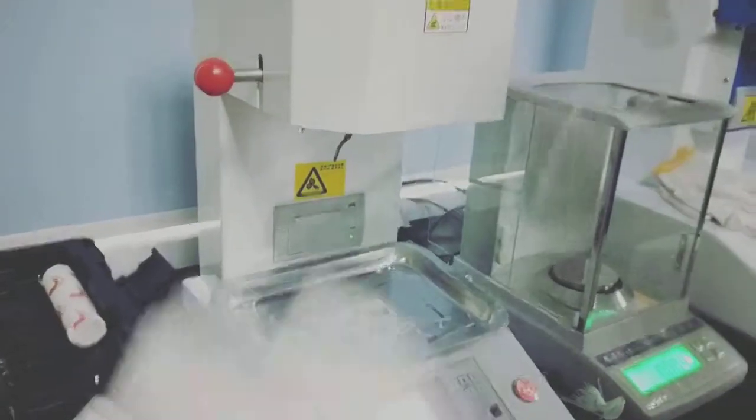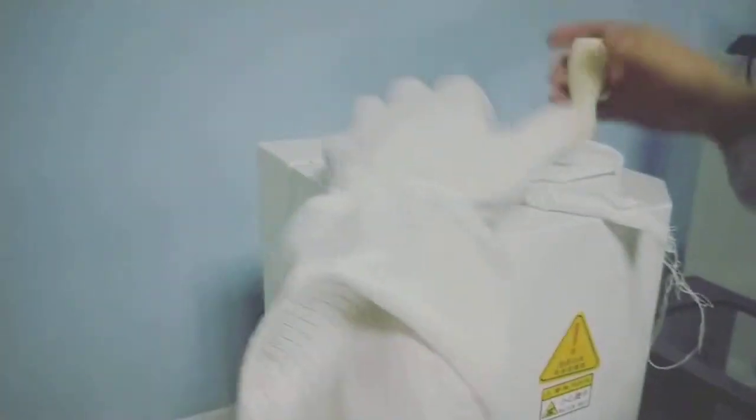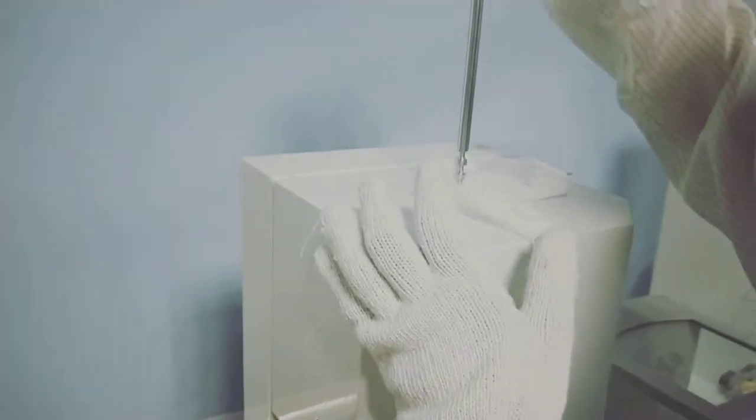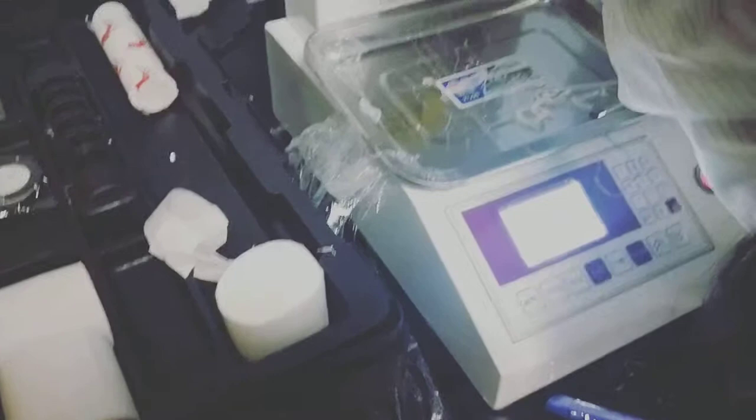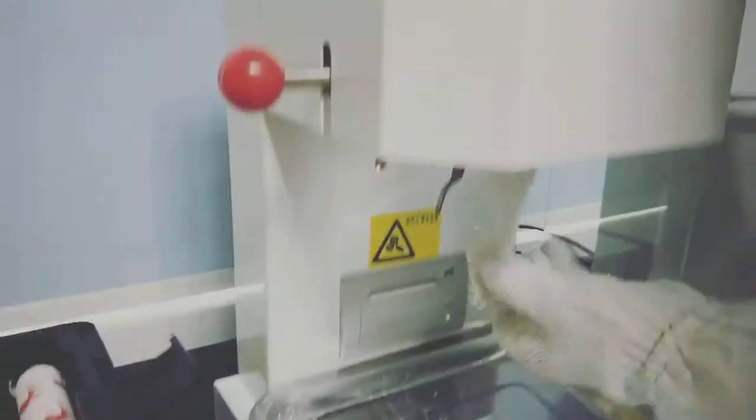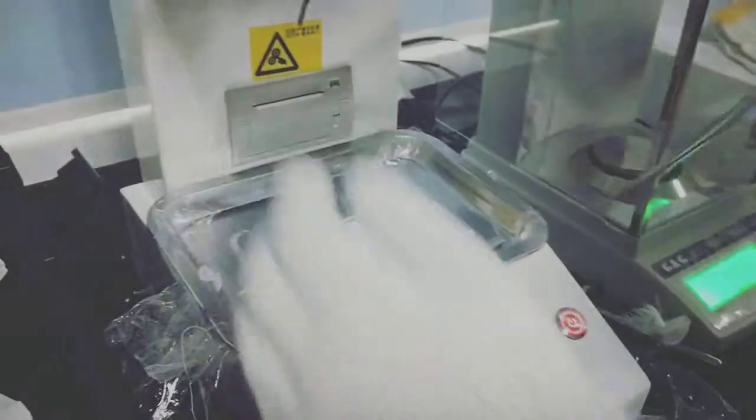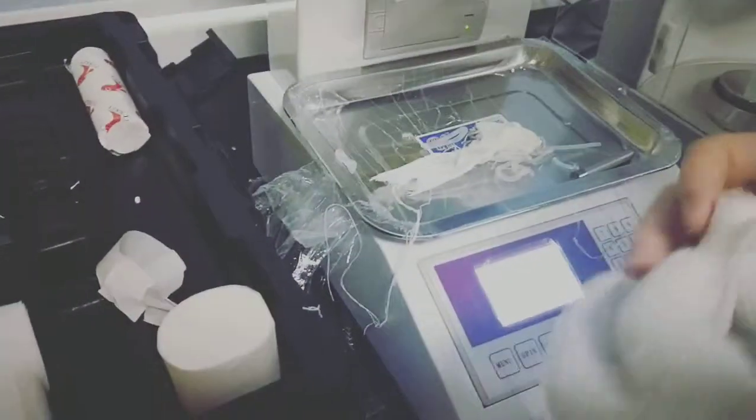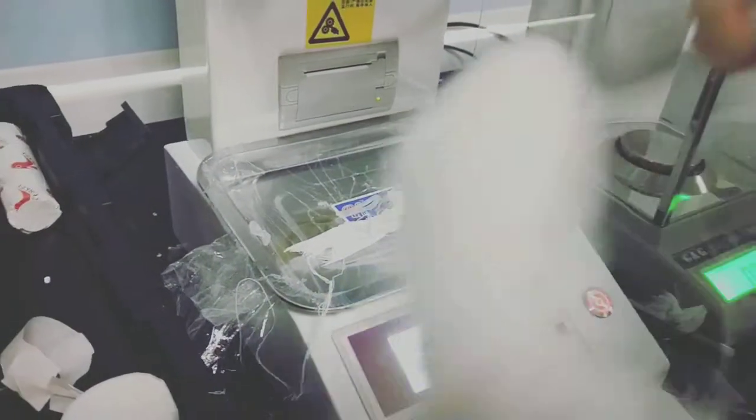Then clean the sample tank. Clean two to three times.